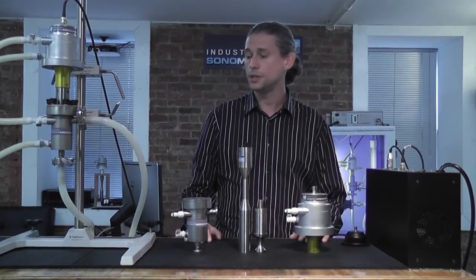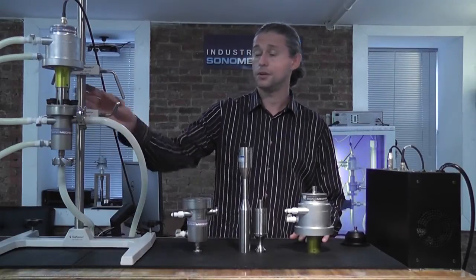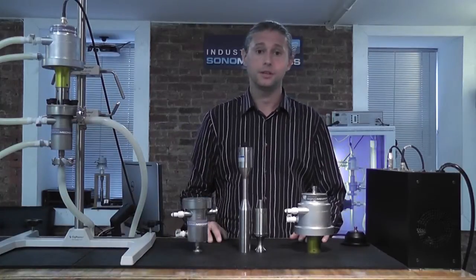In this video, we'll be using the configuration which is assembled on a support stand rather than in an enclosure.